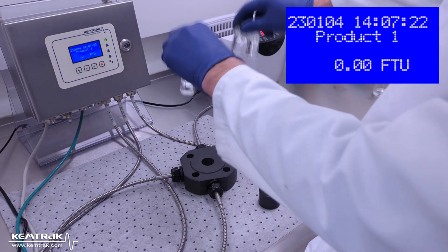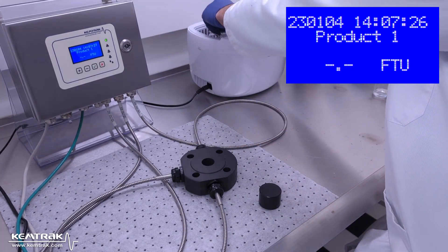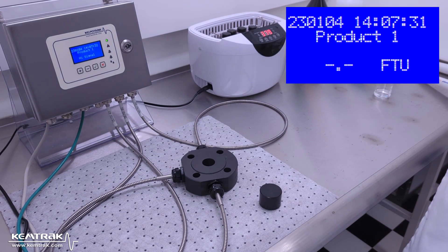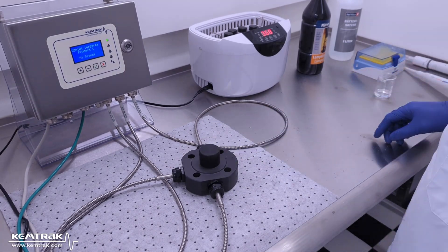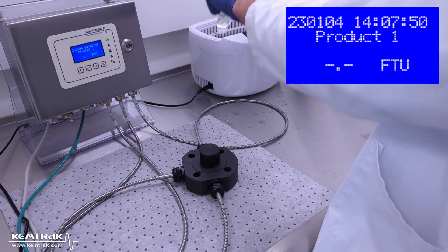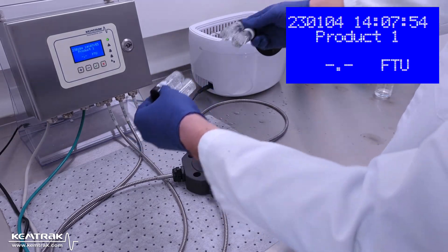So I put the samples in the ultrasonic bath. The ultrasonic waves will disperse the water in the kerosene. I leave the samples in the bath for five minutes, shaking intermittently, to be sure no water sticks to the glass.